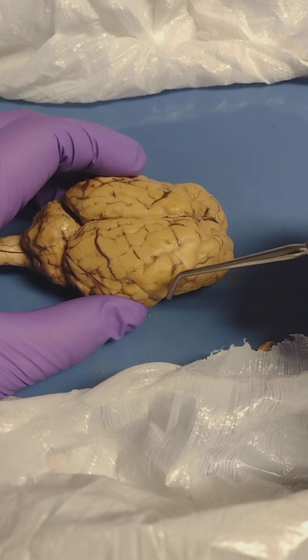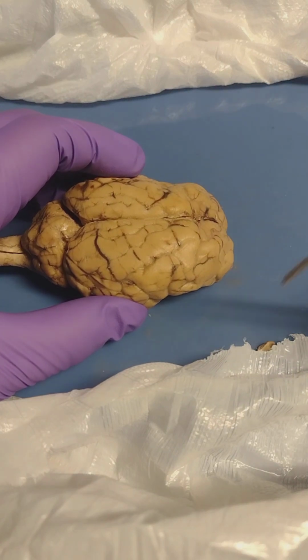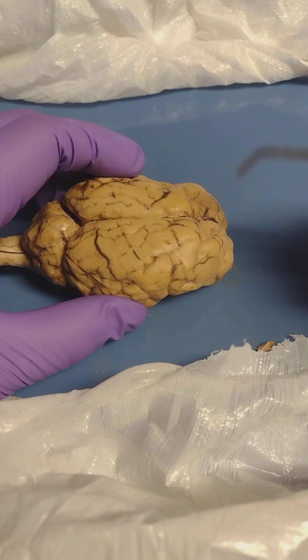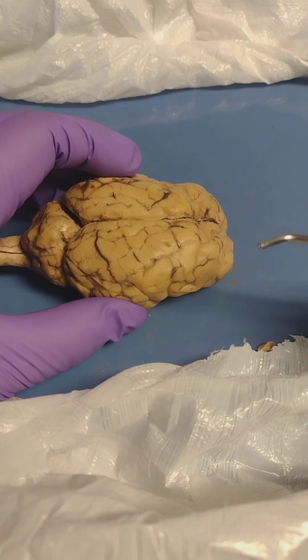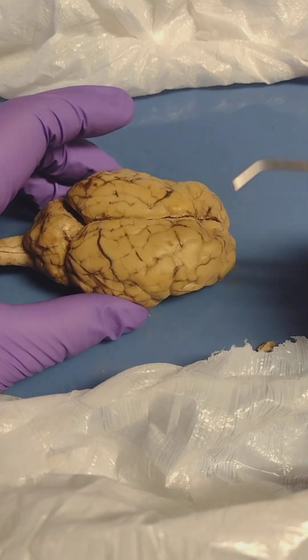On the left and right sides, like I said, we have the temporal lobes. The temporal lobes are for audio processing, and you can also find short and long-term memories, or the ability to create memories here. And then on the left temporal lobe, you would actually find Wernicke's area, which helps with understanding language. And then the occipital lobe back here is primarily used for processing vision.